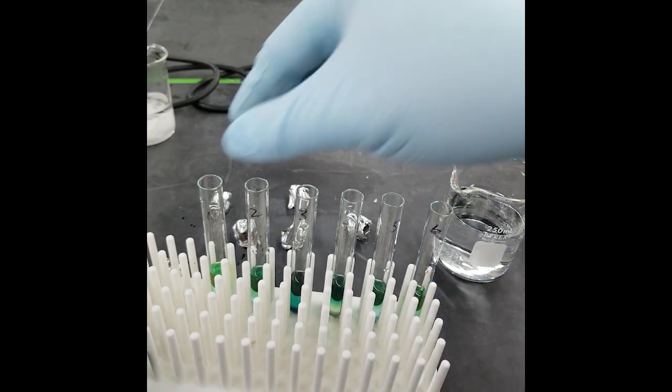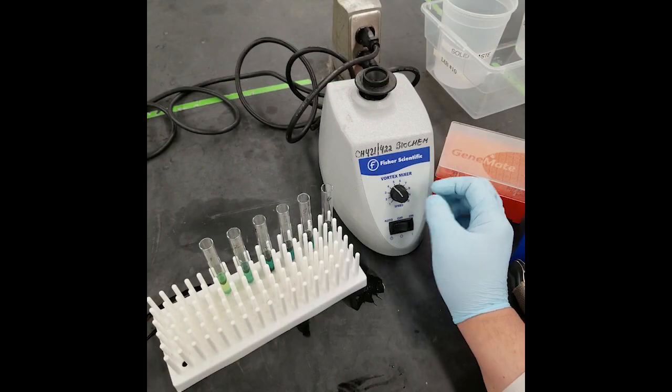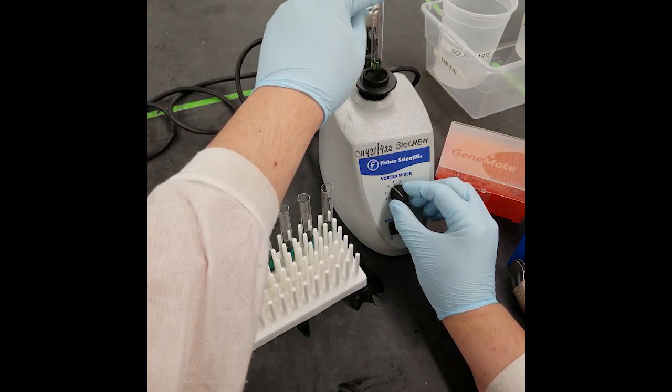During the five minute incubation step, mix the tubes by either shaking them or using a vortex to gently homogenize the sample.